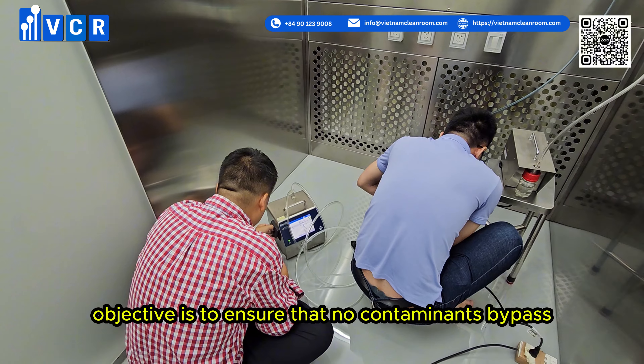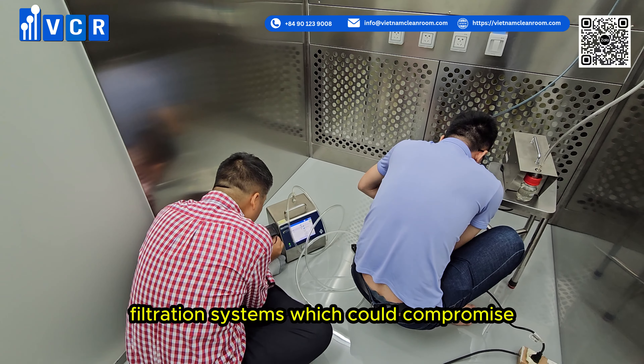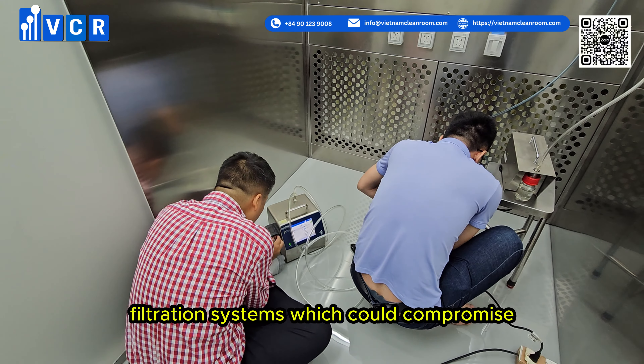Leak testing is a quality assurance process used to verify the integrity of clean room components and equipment. Its primary objective is to ensure that no contaminants bypass filtration systems, which could compromise the cleanliness of the controlled environment. Clean room equipment often relies on HEPA filters or ULPA filters to remove airborne particles. Even minor leaks in these filtration systems can lead to contamination, posing risks to product quality, safety, and regulatory compliance.